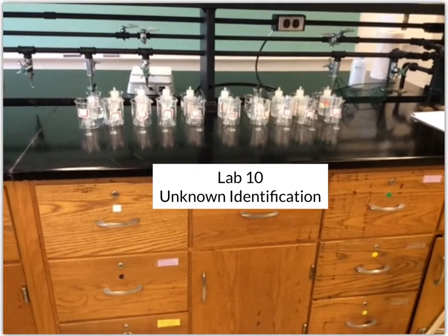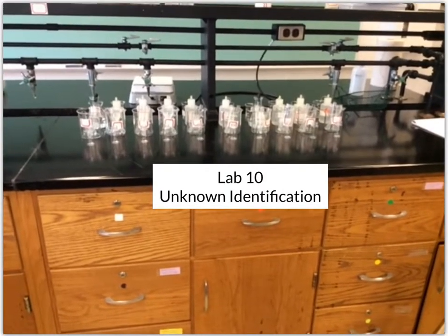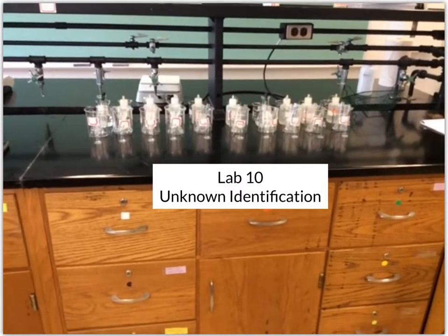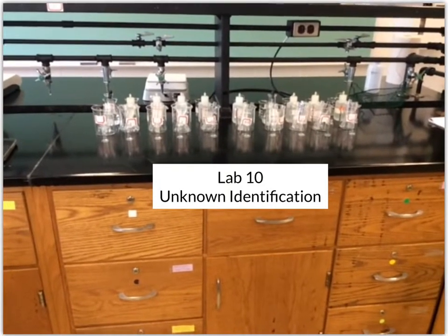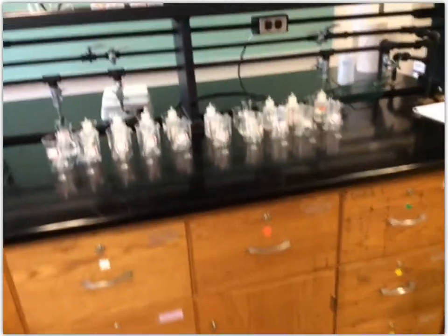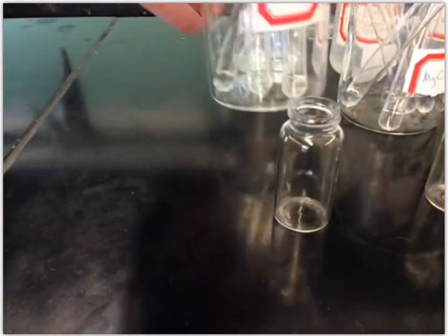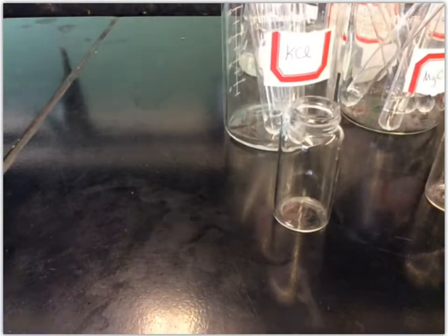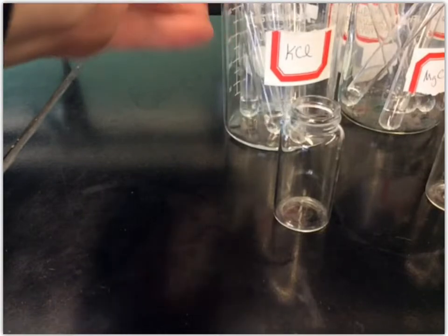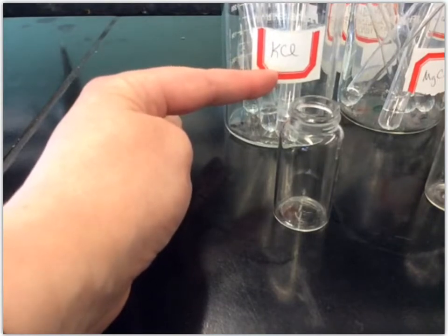For lab number 10, we're going to be identifying some unknown solutions. So first, before we get to the unknown solutions, we'll do some tests on known solutions, which are possible identities of our unknowns. I've got a set of 10 different known solutions here. I've got a beaker of each substance and test tubes that already have some of those substances in them. I've prepped that for all of these, and I've got them labeled so as we go through you can see what known substances we have.